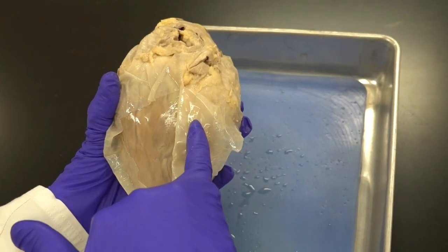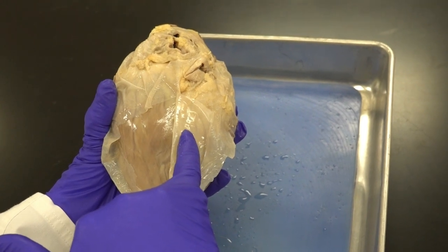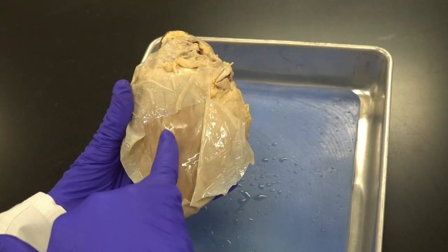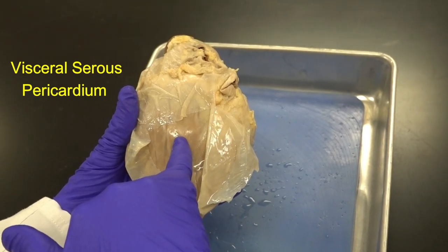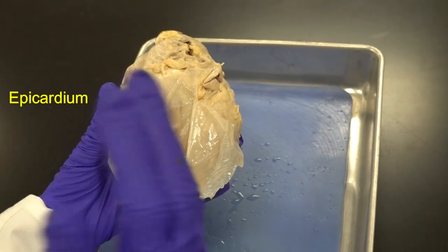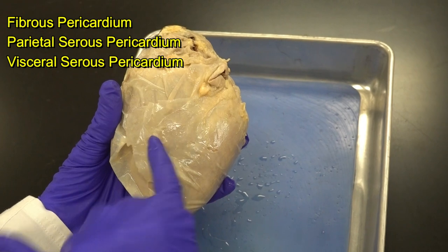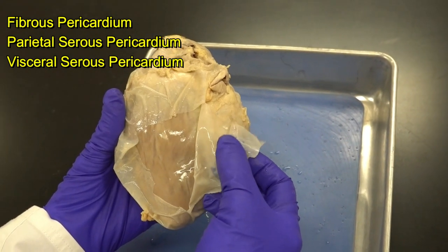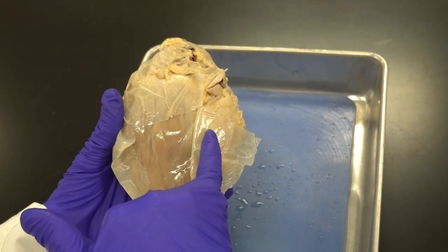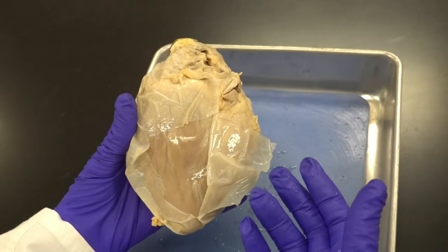On the inner wall of the fibrous pericardium we have the parietal serous membrane attached to the inside of the fibrous pericardium, and the visceral serous membrane attached to the actual heart. Recall that the visceral serous pericardium is also referred to as the epicardium — one of the layers forming the wall of the heart. Between the visceral and parietal membranes we have a thin film of serous fluid that lubricates the area and allows the heart to move easily without friction.